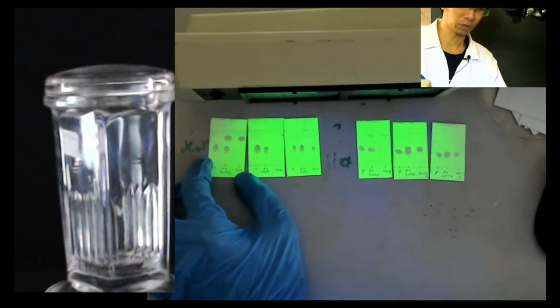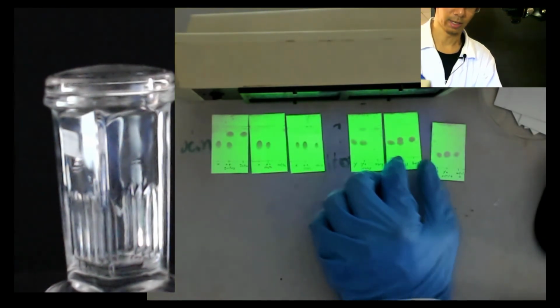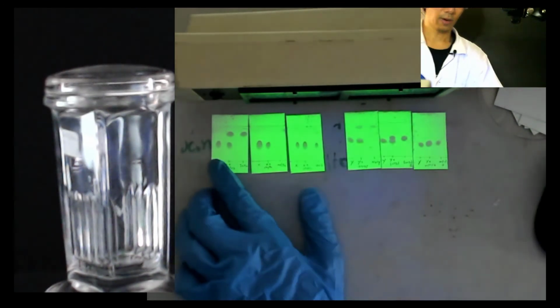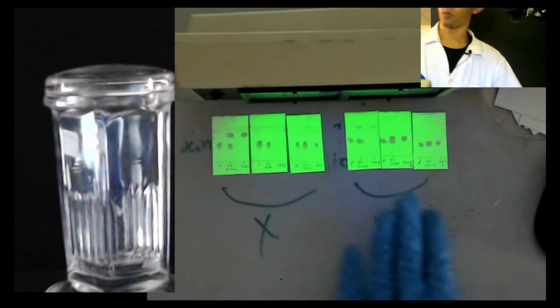So I don't need to use the camcorder, you can already see this. Now this is X here, Y here.